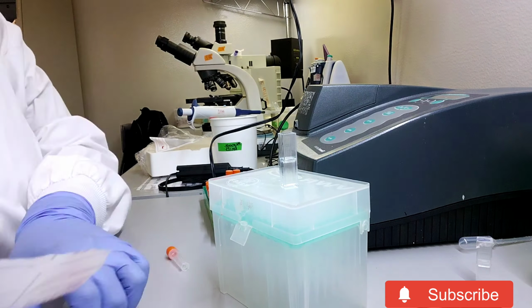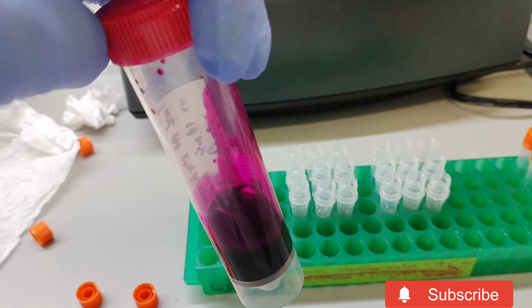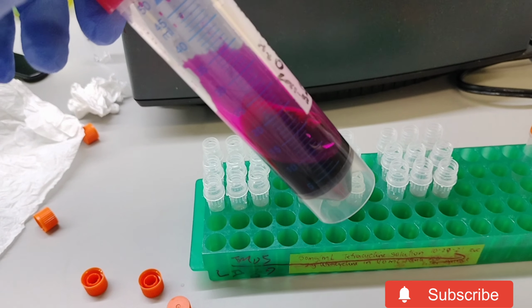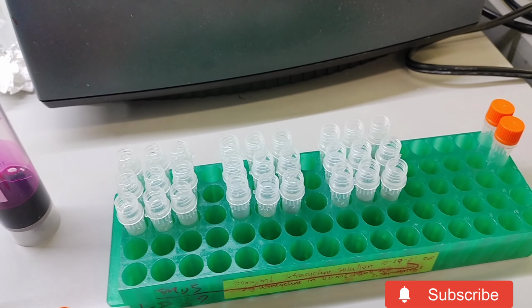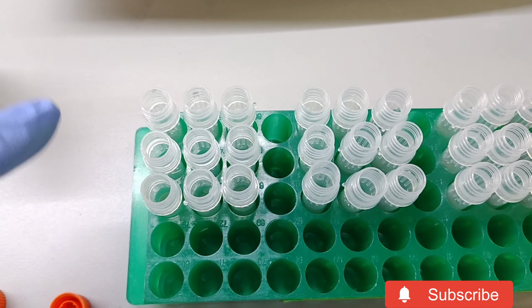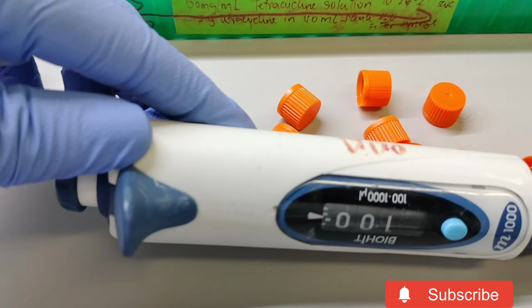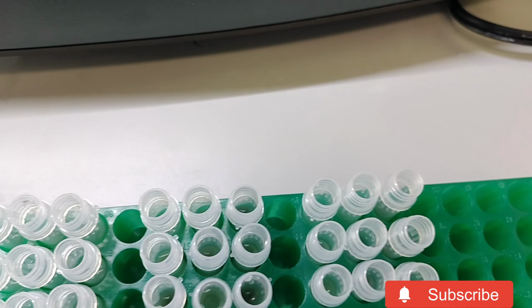So now I'm going to add acid fuchsin. It's an acidic dye. Same process, it stains the cell wall of the fungus pinkish peachish. So I'm just going to put, I think, 100 microliters into each of these vials, and then let them incubate before I look at the spores.